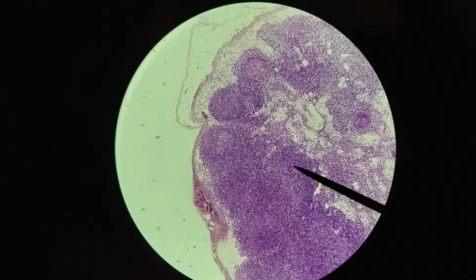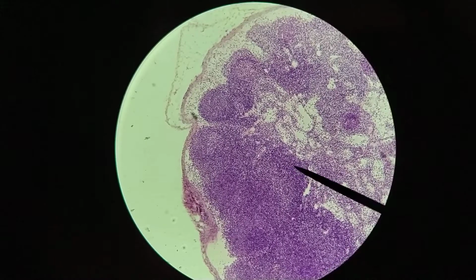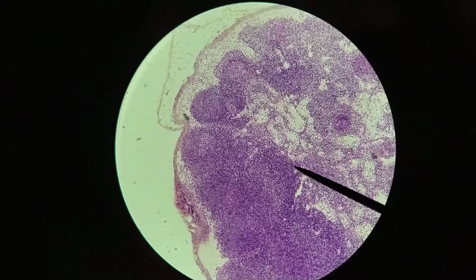And basically they will be presented to these cells to see if any of them recognizes that particular antigen and if it can actually respond to it appropriately. So if it can produce the right antibody, or if it's able to recognize this is something that doesn't belong and attack it. And so in those cases, those cells will be able to proliferate, and then they will exit the lymph node through the efferent lymphatic vessels, okay? Or efferent lymphatic vessel singular, okay?